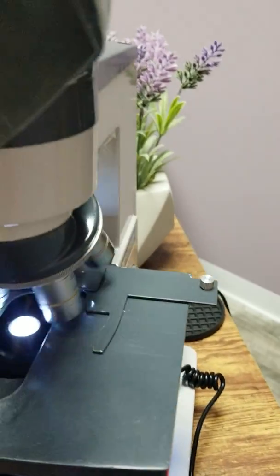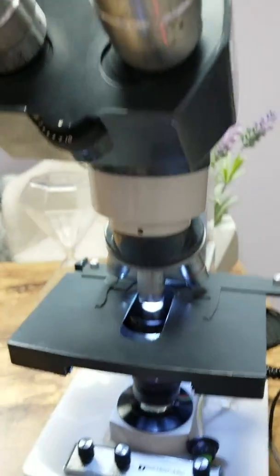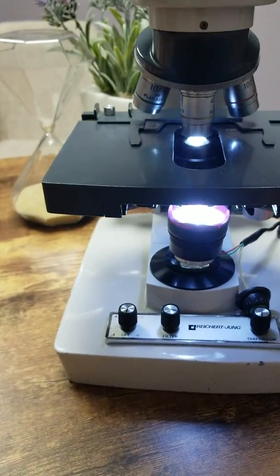Look into it, and make sure there's no—oh, that's why it's not working. I can't see it very well, but make sure there's no ring of light. So make sure everything is completely covered light-wise.